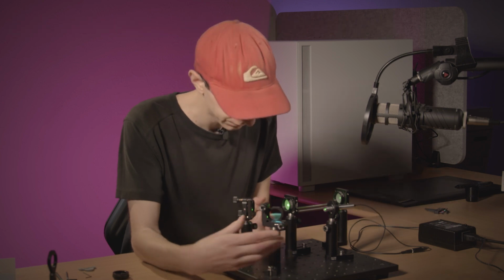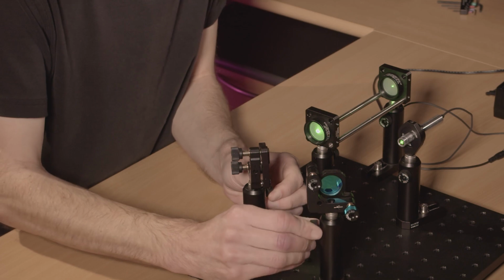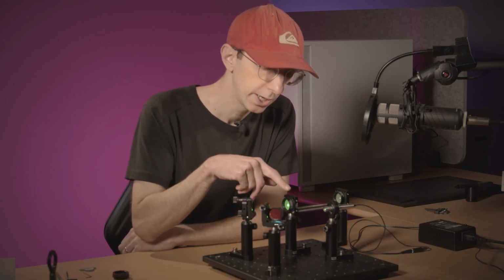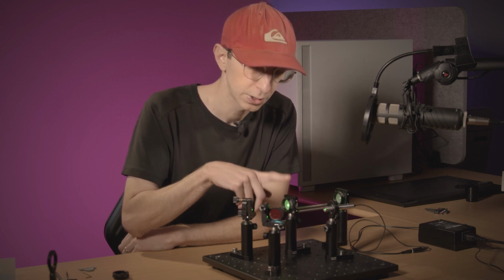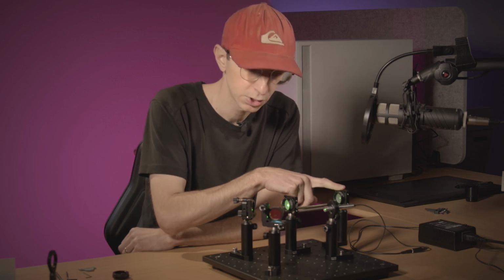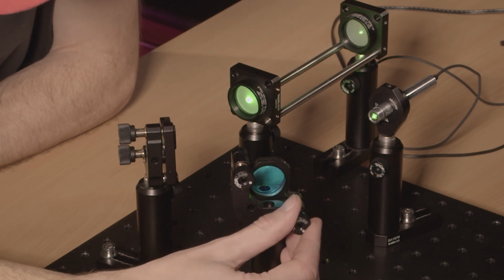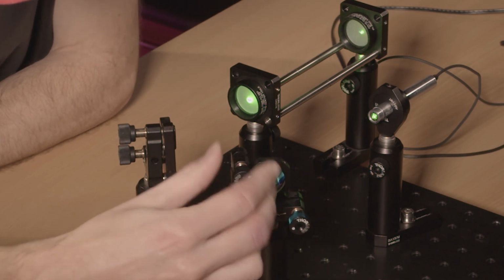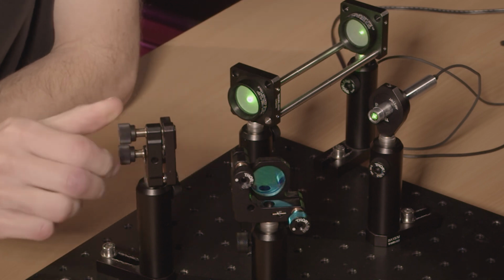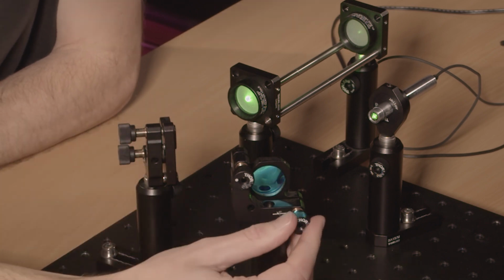So that's very close to what I would like to achieve. So I will secure my mirror. And now, using the first mirror, I will adjust the position of the laser on the first aperture. And using the second mirror, I will adjust on the second aperture position. And you will do this iteratively, so it's going to take just a bit of time, but that's really a matter of even sometimes less than 1 minute to do the proper adjustment. So I will bring it close to the hole.